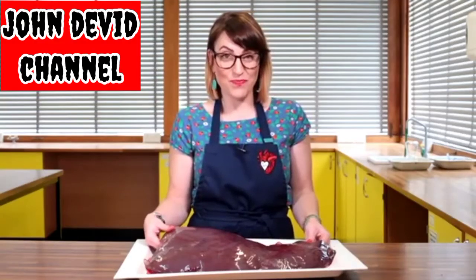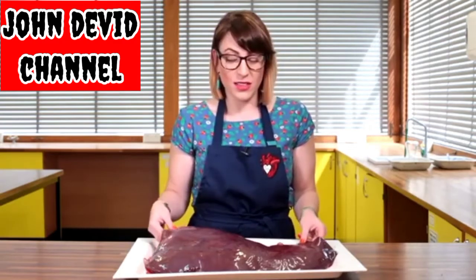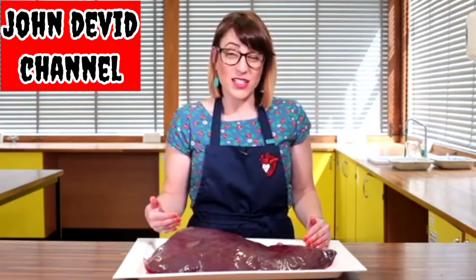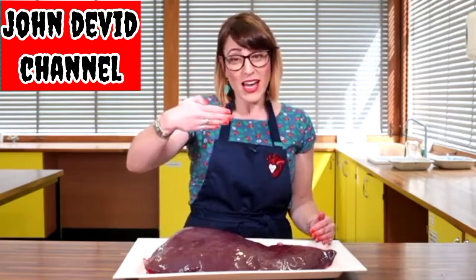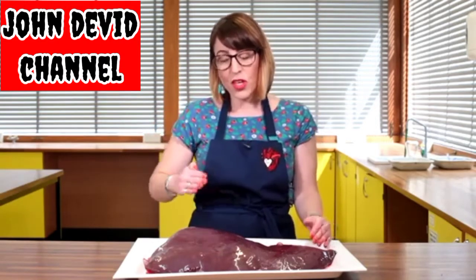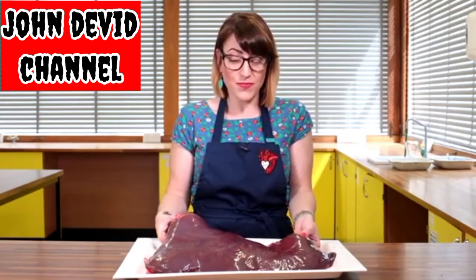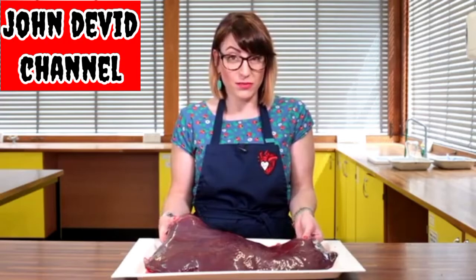Liver dissection. Here we've got the liver, one of the largest solid organs in the body, and is also a gland. Now, in terms of where your liver is in a human, if you take your right hand and place it under your rib cage, it's approximately just there. And in a human male, this can weigh up to 1.8 kilograms and contain up to a pint of blood.